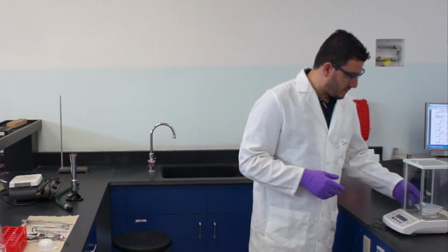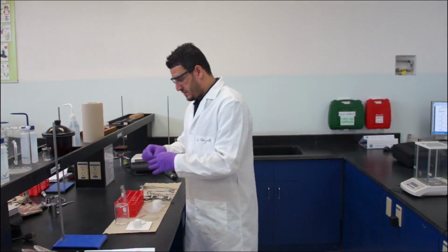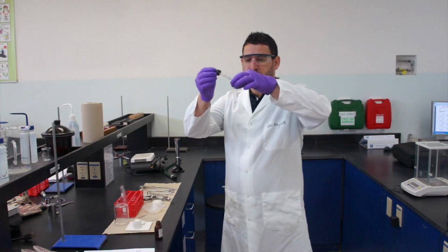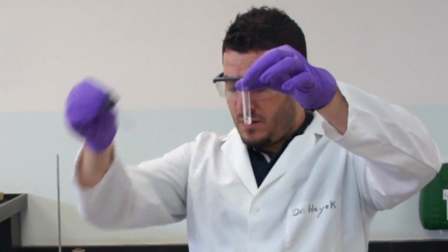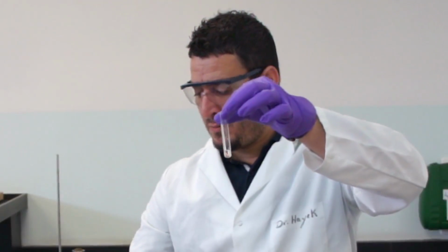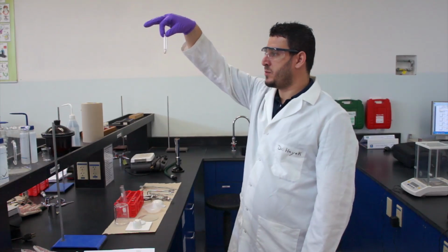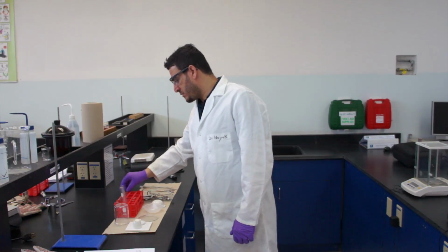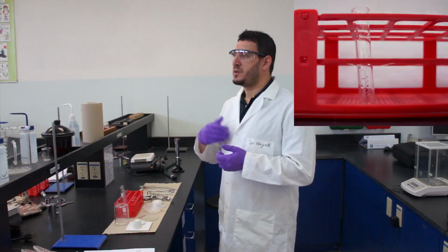Now after you do this, you'll take the copper wire, insert it into the tube, just like this. You will add silver nitrate until all the copper wire is immersed. Okay, so in your lab manual it says you could add 3 milliliters. See, so the copper wire is fully covered by the solution of silver nitrate. We will leave it. We will get back to it at the end of the lab. What we will do, we will just take it out, clean it, and reweigh it.